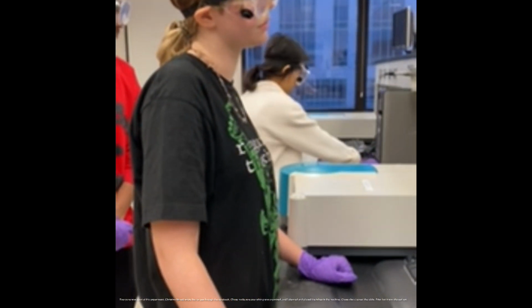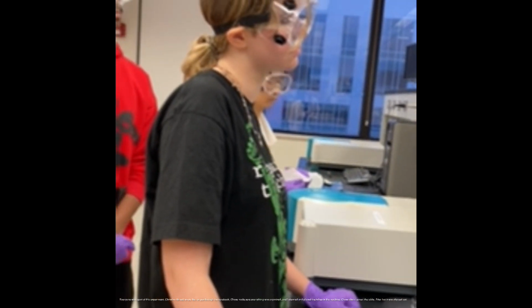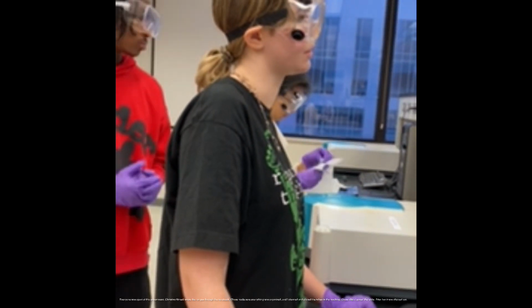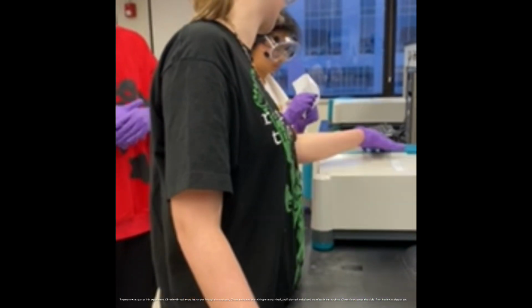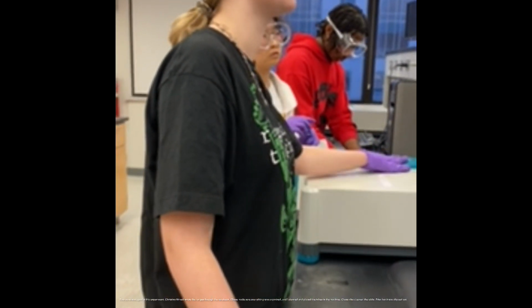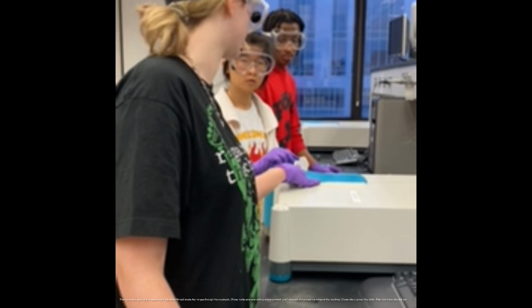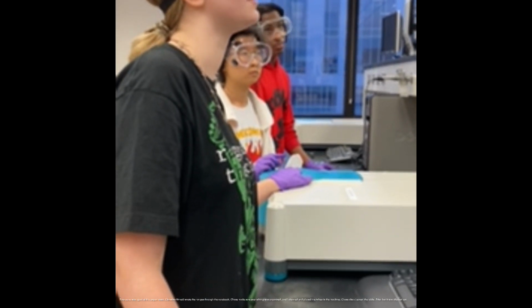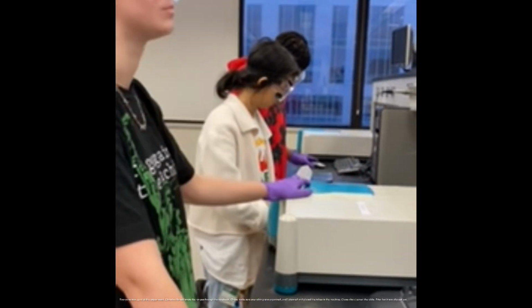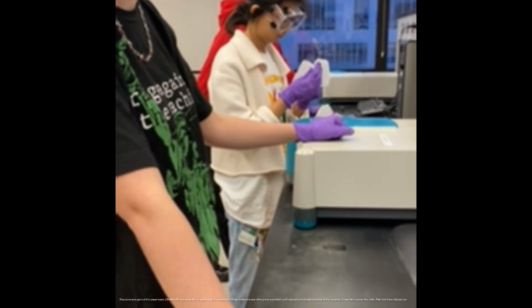Okay, good job. And then I gave my group the two examples that I came up with for why we should scan across all wavelengths. One I gave them was to find the lambda max, I think that's what it's called, so we know which color of light gives the best reading, because I'm referring back to our last lab. And the second one I told my group mates was to tell the substances apart. I noticed that different things have different lambda max values, which gave us different numbers and showed what it looks like from the color of what we know.